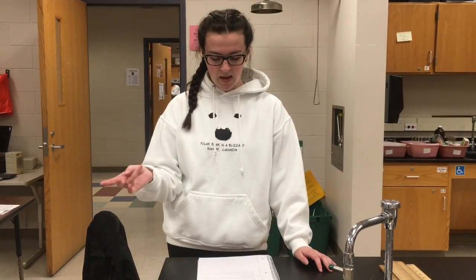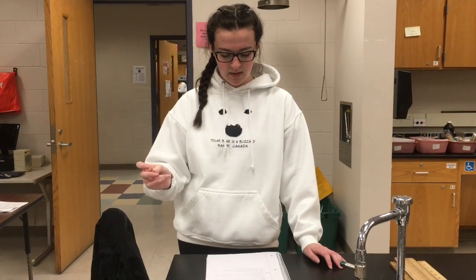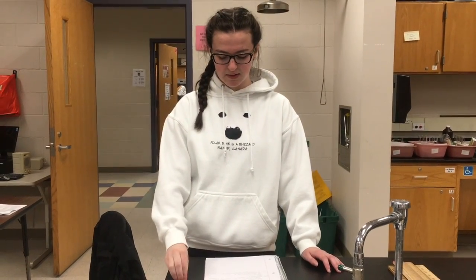through the adsorbent. So it works when the components of a mixture have varying affinities for the eluent, and you should always take note of the polarities of the adsorbent and the eluent, because a change in polarity could change the attraction of the adsorbent. So we're using paper chromatography, and the paper is the adsorbent. The eluent can be a number of things, and the eluent moves up the paper by capillary action, and the molecules within the polarity closest to that of the eluent will move up the paper most.